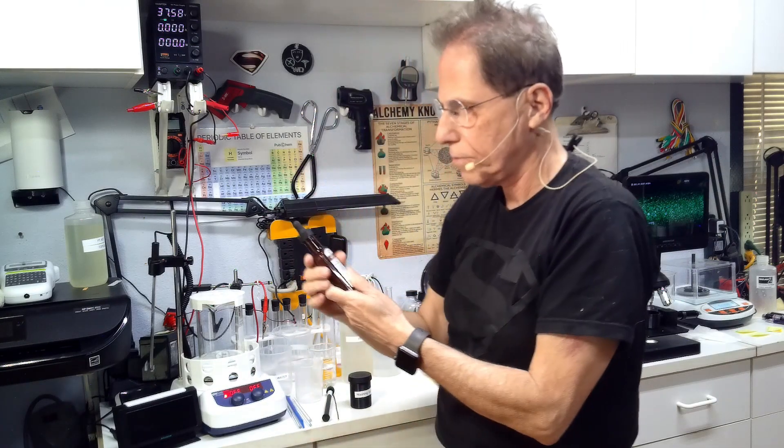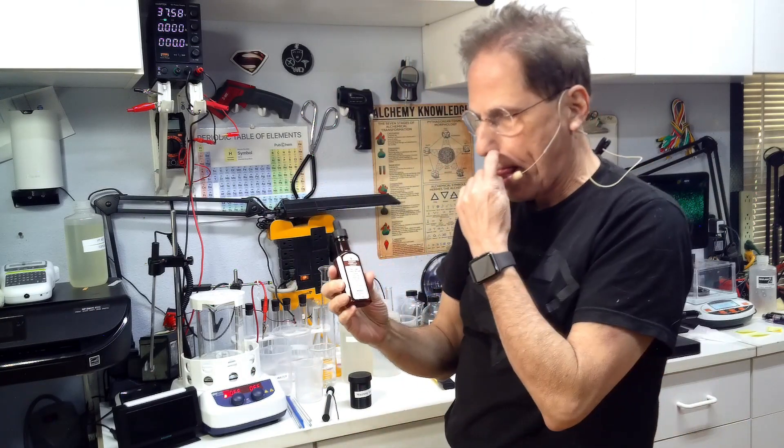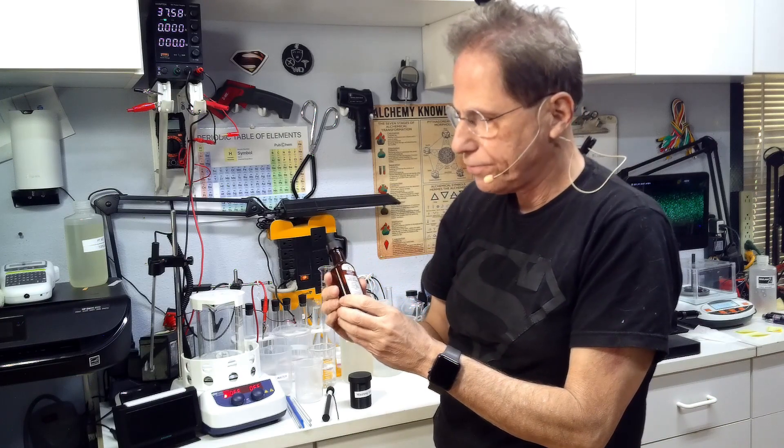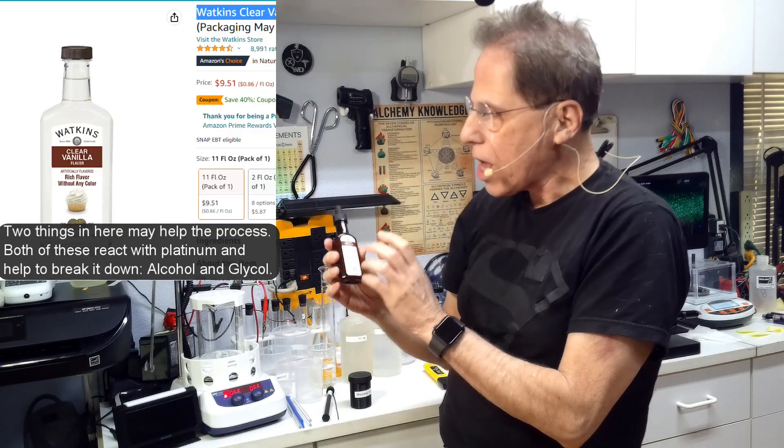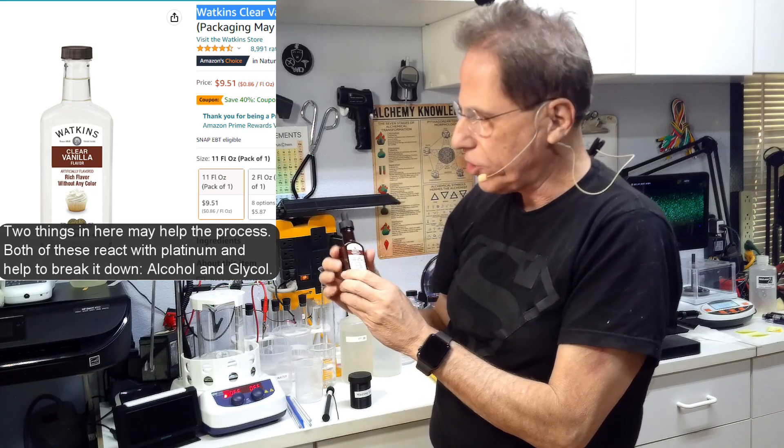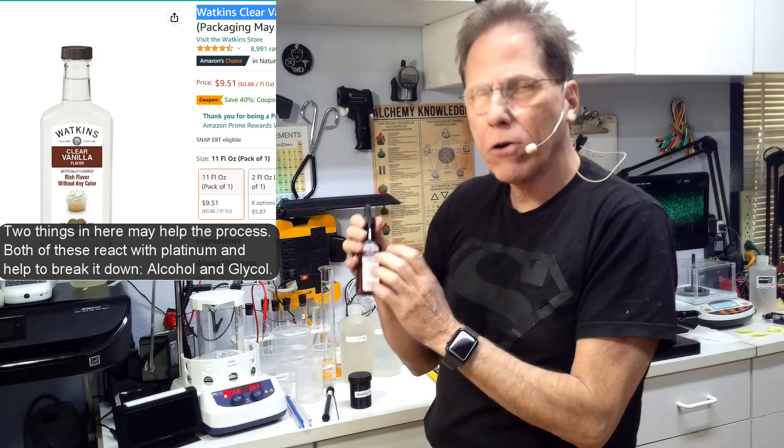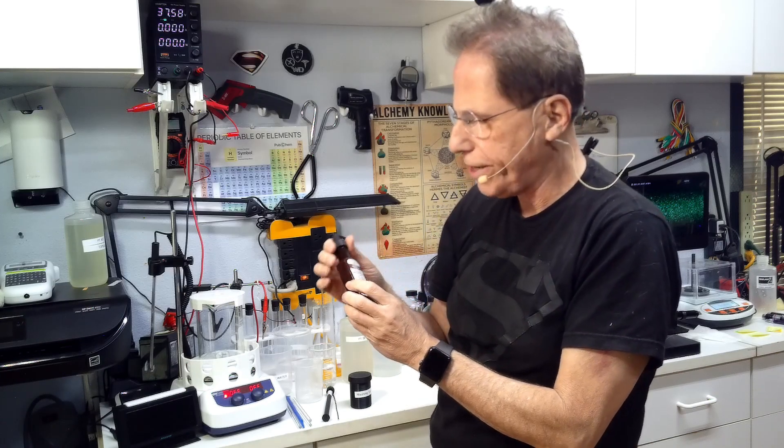I want you to make sure you watch the video on how to make washing soda from baking soda. We need the high pH of washing soda. Baking soda is only going to get us to 8.5. Washing soda will get us to 10.75. So that's the first player that you're actually going to need. You're going to need vanilla. This is vanilla extract, well vanilla flavoring or vanilla extract. There's alcohol in flavoring and extract, and it's uncertain... the alcohol is another agent that helps react with the platinum to break it down.